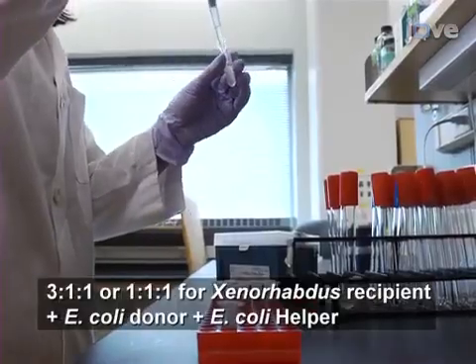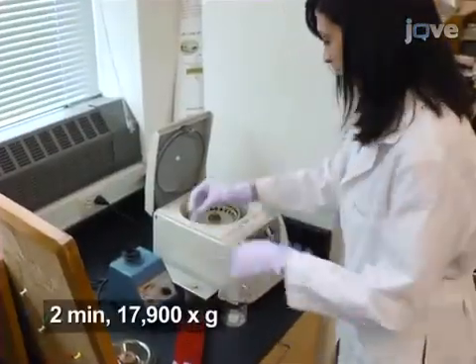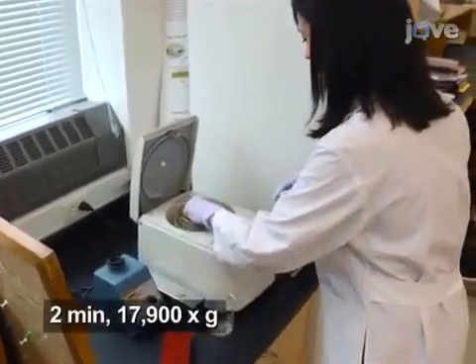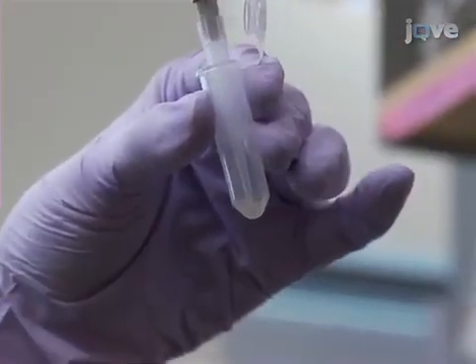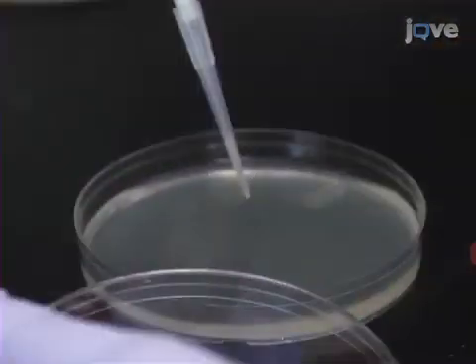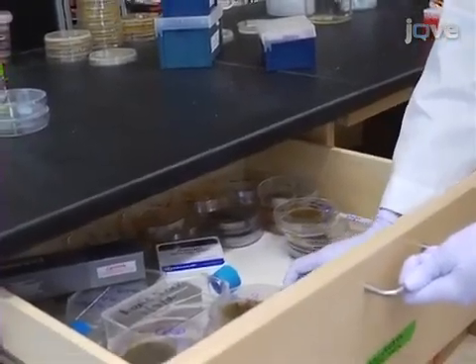Next, combine the strains in a single microcentrifuge tube and centrifuge the mixed cultures for 2 minutes at 17,900 Gs. Decant the supernatant and resuspend the pellet in 30 microliters of fresh media. Then spot the suspension onto a nutrient-rich media plate without any antibiotics and allow the spot to dry.